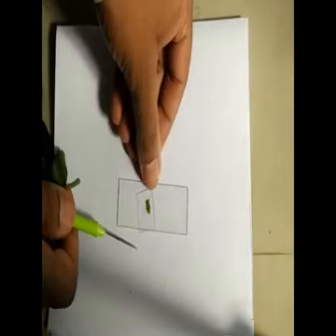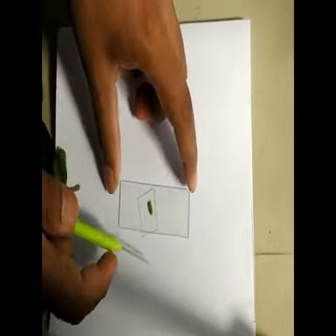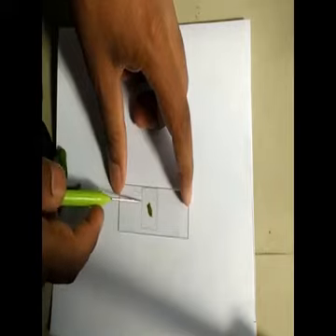Air bubbles will interfere in the proper projection of the slide, because air has a different refractivity compared to water, and in the microscope we are using light as a medium to catch the image.